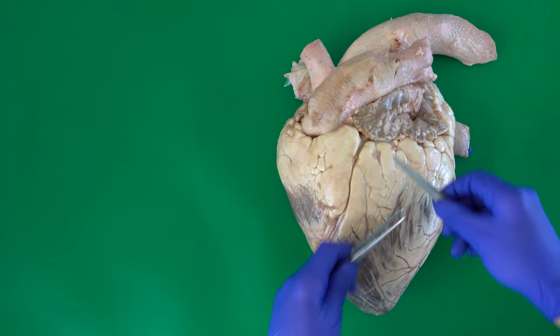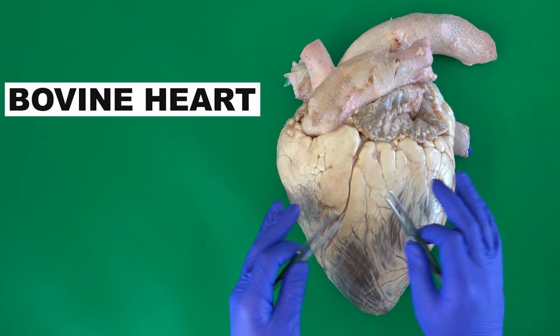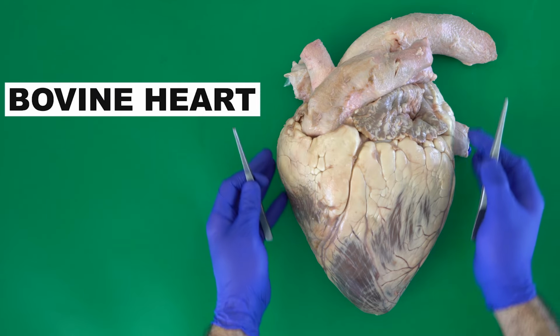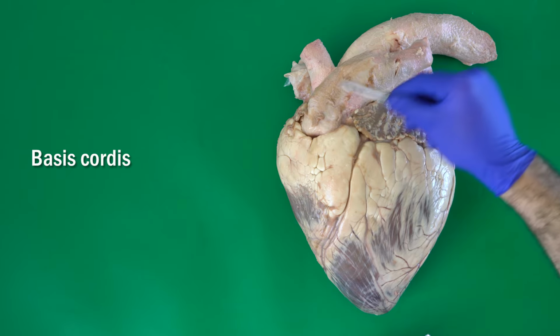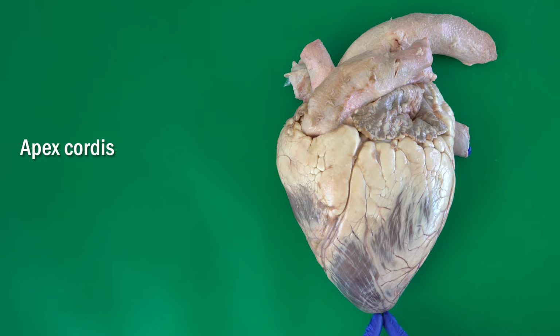Okay, here we have the heart of the ox. Before we start talking about the details of the heart, let me just describe the heart in general. The heart has a base. This is the base of the heart, where we have the main arteries. And we have the apex. This is the apex of the heart.